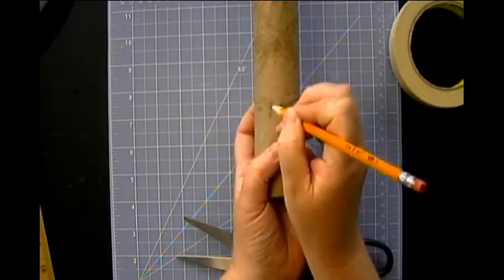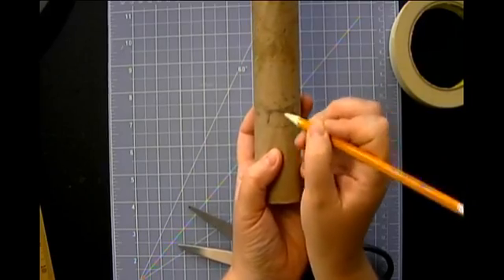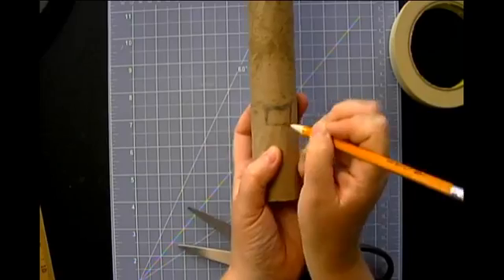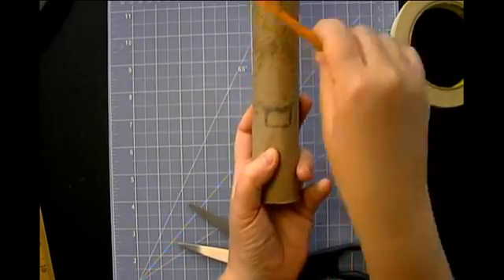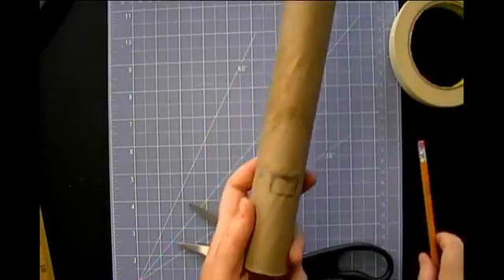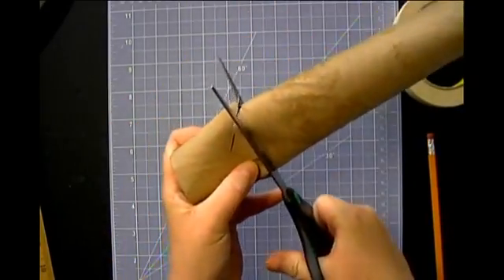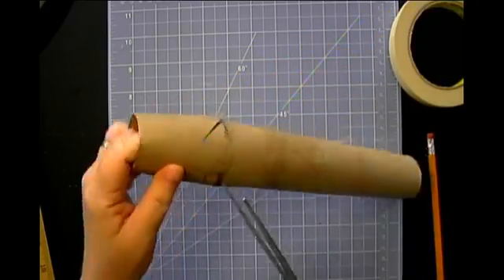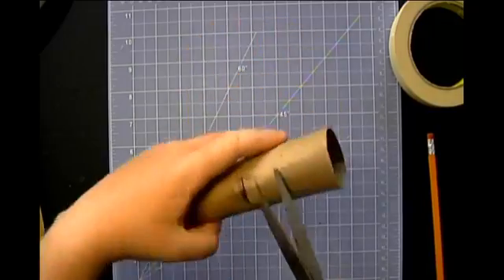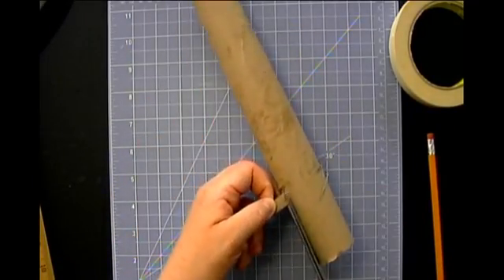So you can do a circle. I just cut a rectangle. I think it's just honestly a little bit easier. And you see I'm just kind of sketching a small hole. It does not need to be big. In fact, you don't want too big a hole because we don't want light to be getting in here. We want all of our light to be traveling down from the top of the tube. So again, I'm just going to carefully squeeze, right? Well, I didn't do a great job there, but that's part of why we have the masking tape, because if we need to, we can always use that to fix our mistakes.